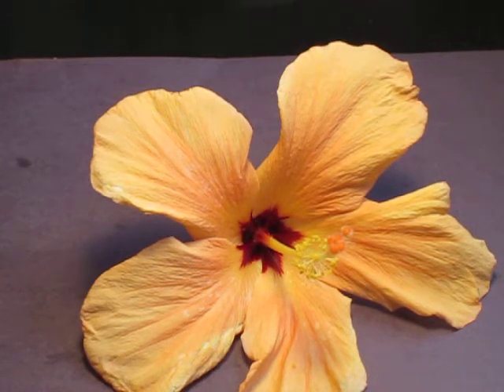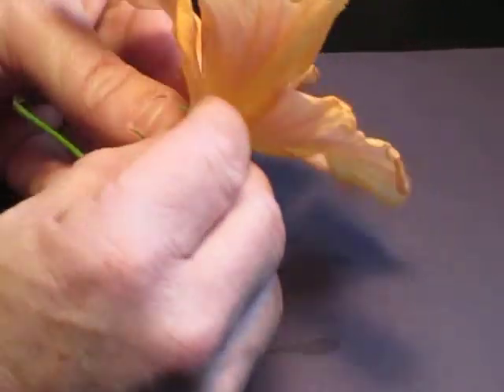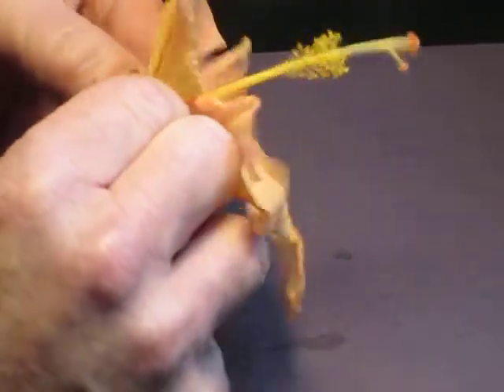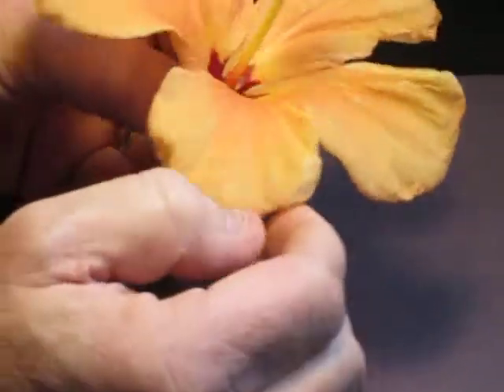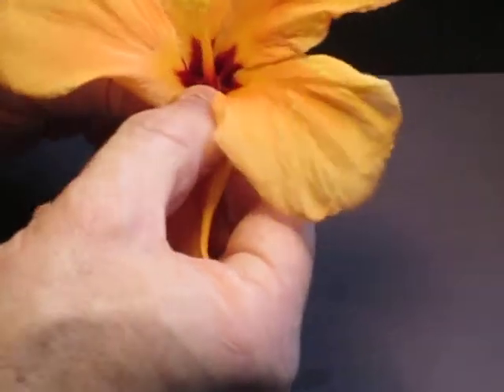So I'm going to go ahead and start talking about the parts of a flower as we dissect this one. The first part I want to talk about is the sepal. That's this green part right here. It kind of supports or anchors the flower, kind of holds the petals in place. I'm going to just peel it off because I found that peeling it off first usually makes things a little bit easier. The next part of the flower I'm going to take off is the petals.